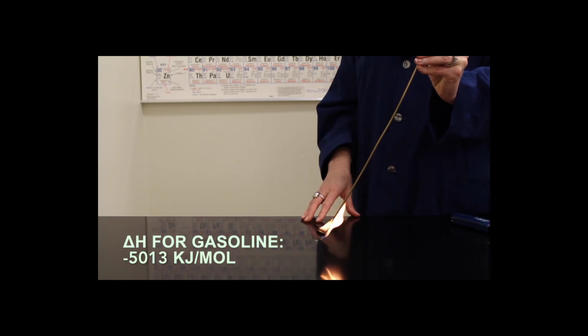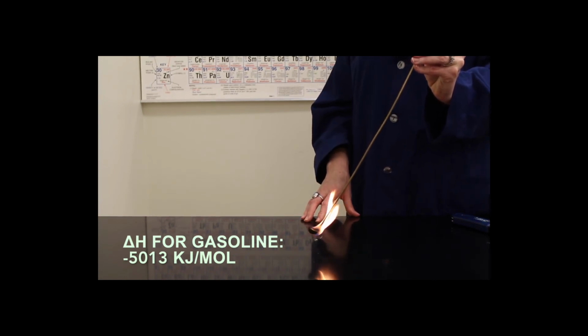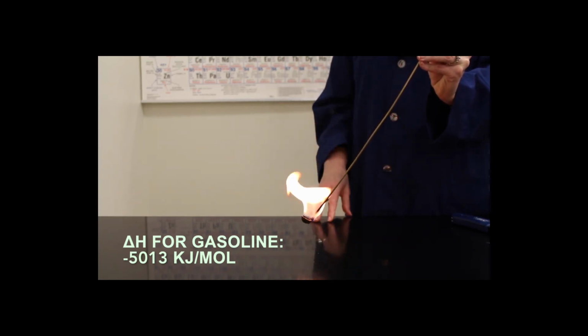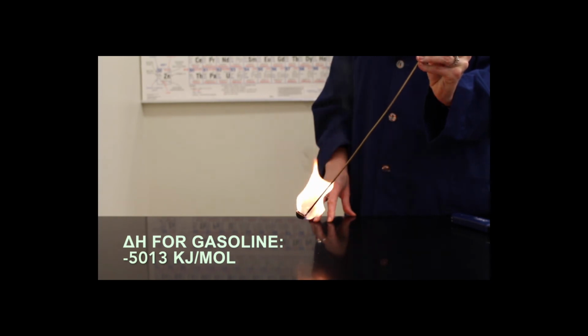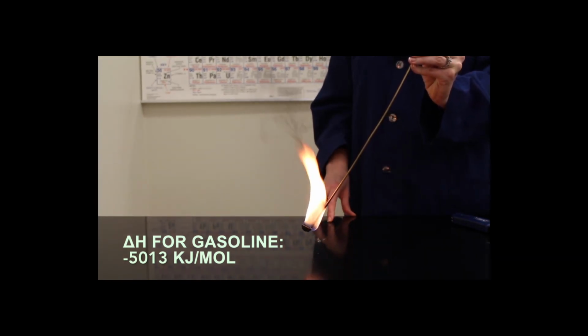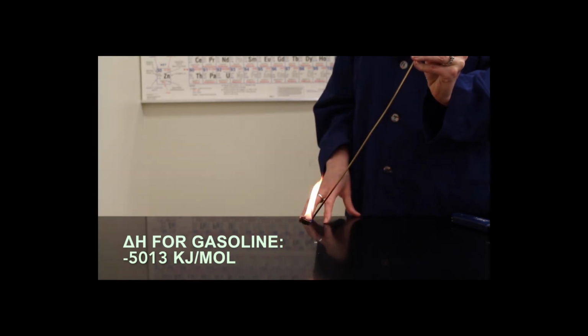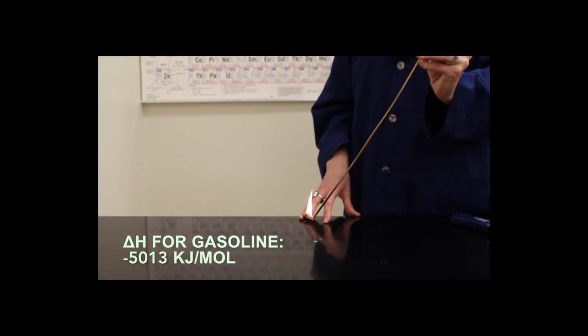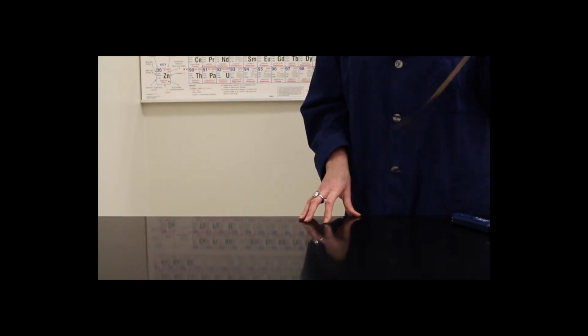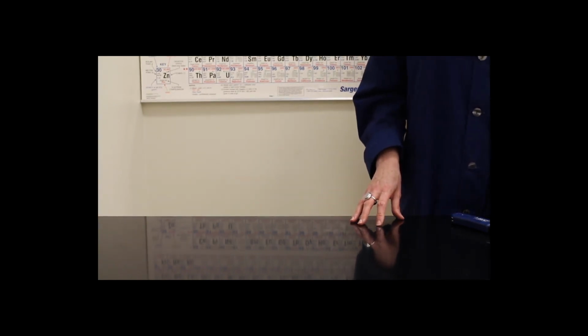What we will see here in a moment is a relatively large flame, and you might notice that there's a lot of smoke being given off. It burns very quickly, and this is a very sooty flame, and this results in pollution from our cars. Again, the large flame correlates to the large heat of reaction associated with the burning of white gasoline.